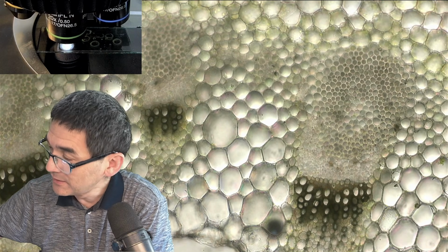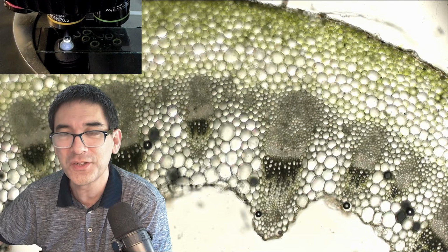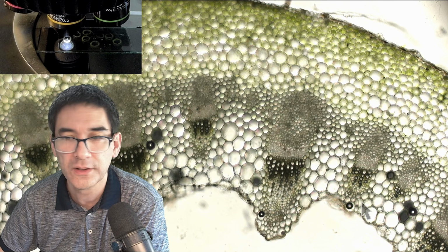So now it's got to be a little bit of biology, okay? So what you see over here is, and I'm going to switch on now, don't worry, not too much biology, right?